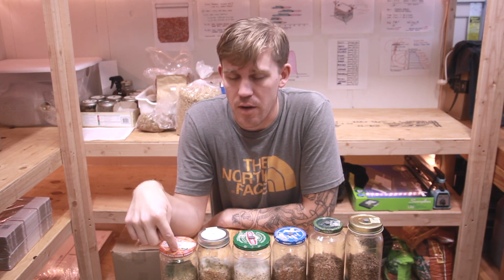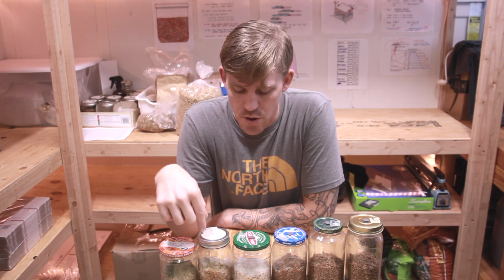Hey, what's up everyone? So today is day 21 of this experiment. Just a reminder of what we got going on here. These 2 jars are both lacto fermented. The first jar I fermented for 10 days. Jar 2 I fermented for 14 days.